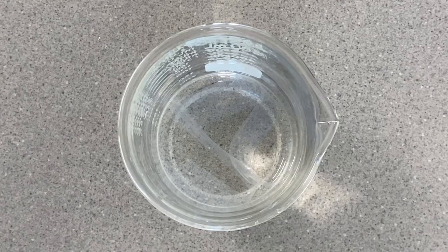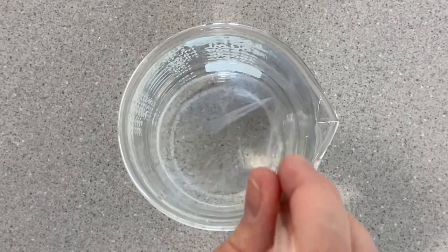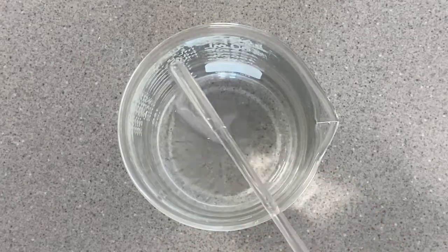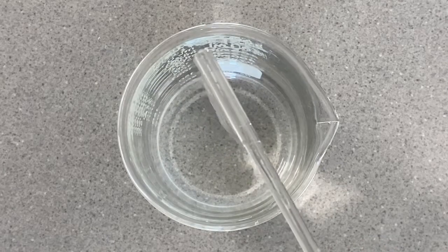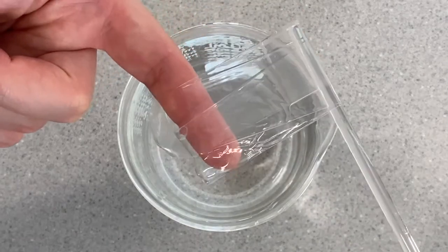Your first step in this lab is to get two pieces of dialysis tubing. They should be soaking in water, but if you get a dry piece, you can soak it in distilled water for a couple of minutes and it should work just fine.